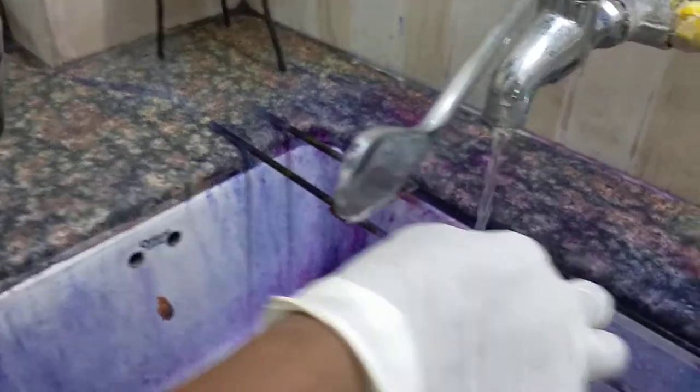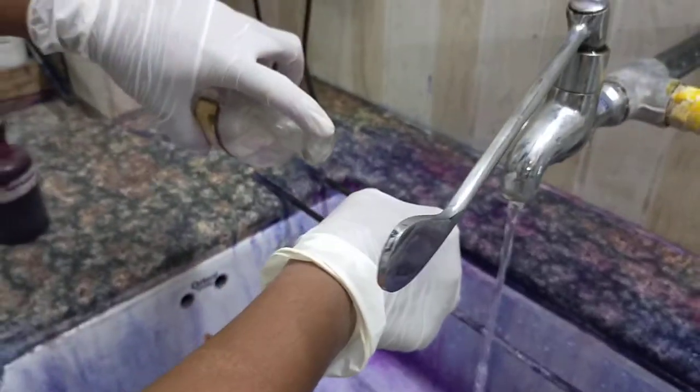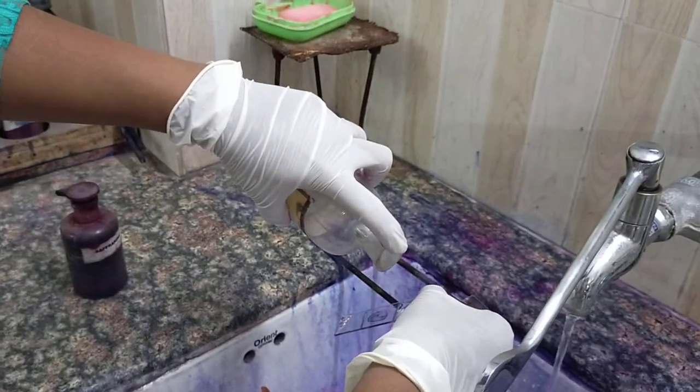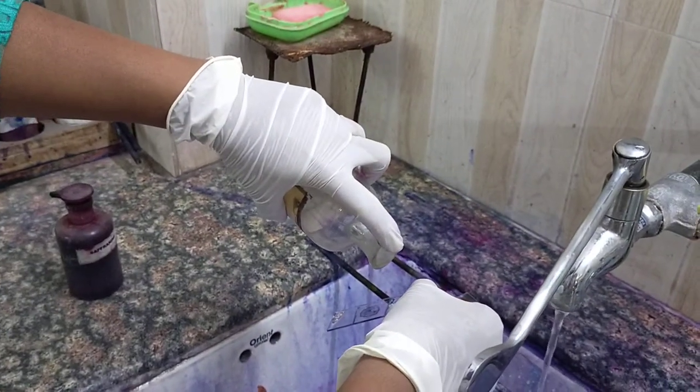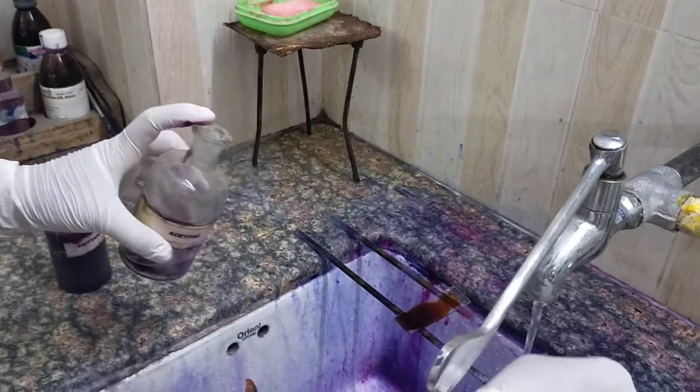After this we will wash the slide and we will decolorize with acetone. Just put 1 drop of acetone for decolorizing.